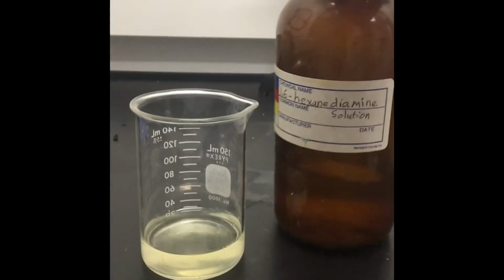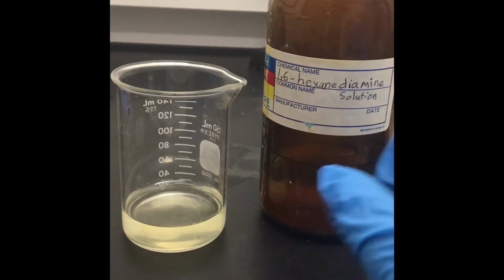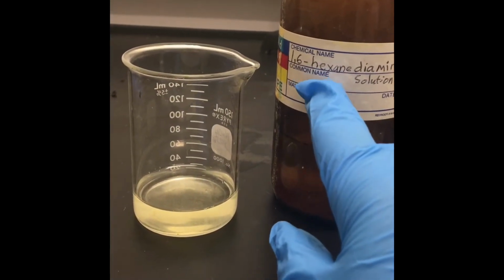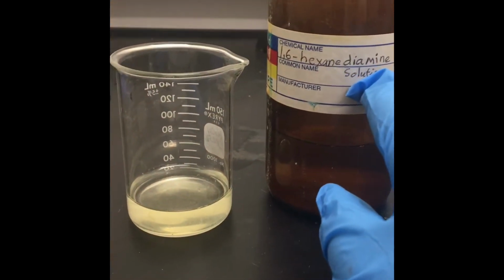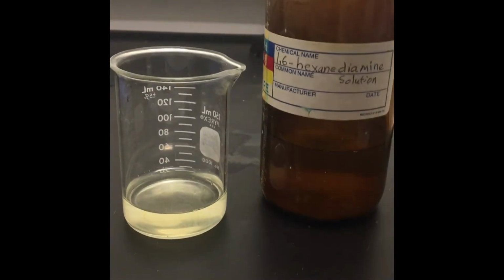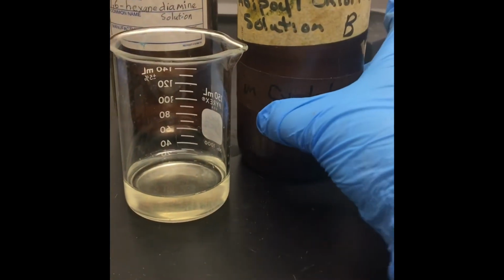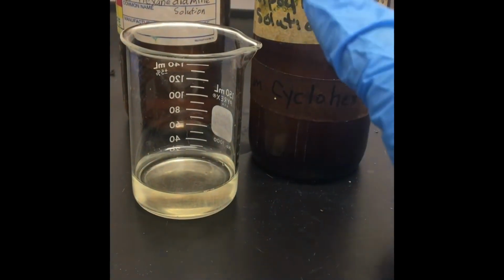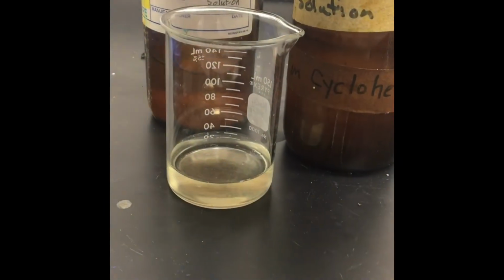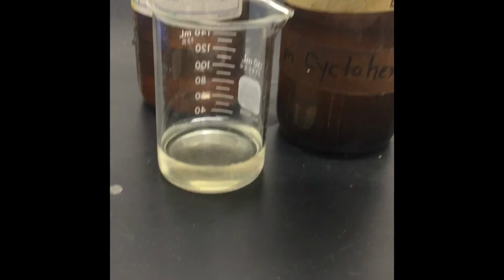One of them is the one that I have here in this beaker, and it's called 1,6 hexane diamine. Basically what it tells me right here, hex, hopefully you guys know, is the prefix for 6. So it has 6 carbons. And then amine means it's a compound that has nitrogen in it. So we're going to have a unit of this that is going to intercalate with another compound that is called adipoyl chloride. Now this is a compound that has chlorine in it, and of course it has a lot of carbon as well. So once I make the nylon, I'm going to have a molecule of this compound bond with another molecule of this, then go back to this one, then go back to this one, and so forth.